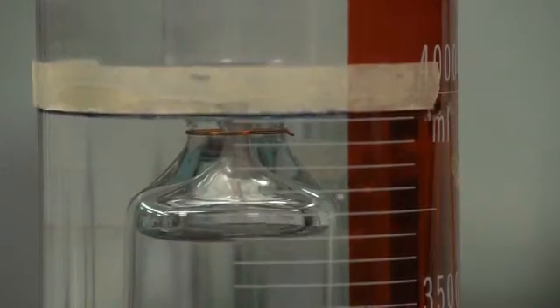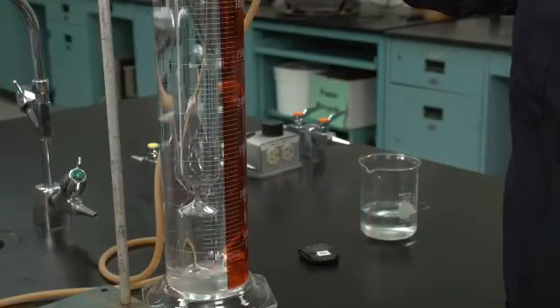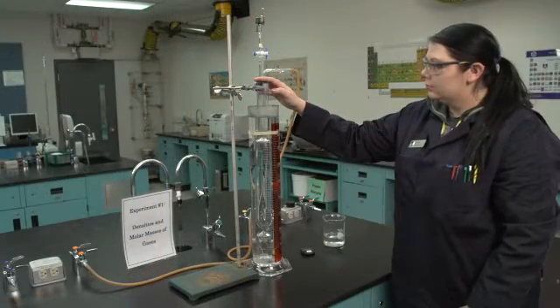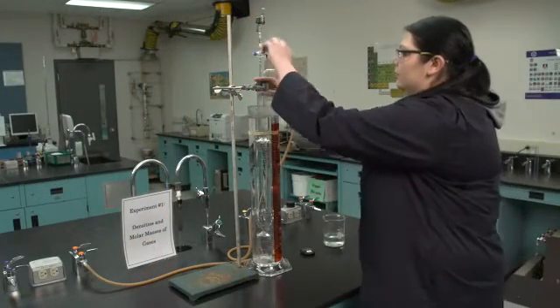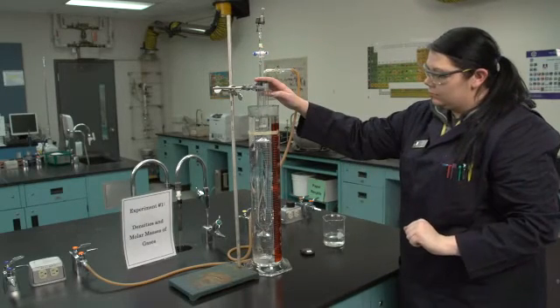The gas should fill the glass tube slowly and then bubbles of gas will be released into the water surrounding the tube. The goal is to saturate the water with the gas and not lose any water out of the top of the graduated cylinder. After approximately 20 seconds, close the stopcock that leads to the effusion hole.